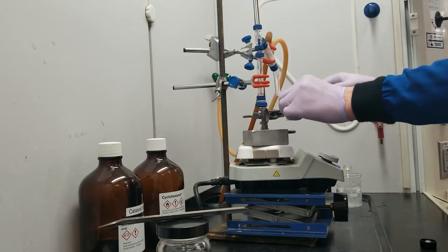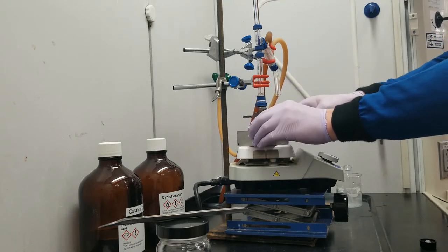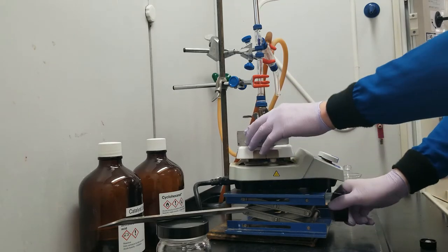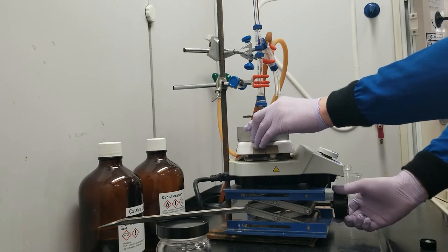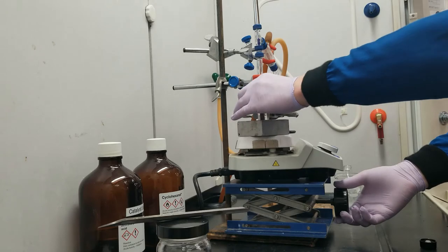And with all the components in, this is not hot right now. I can go ahead and bring my reaction flask up to my apparatus and screw it in here.